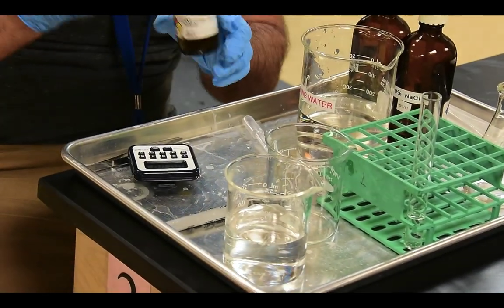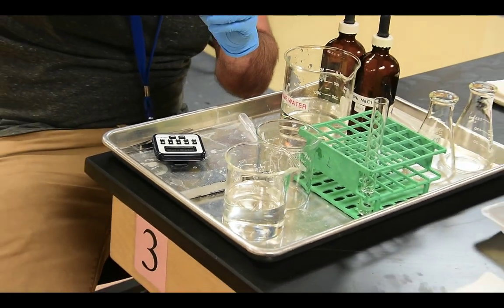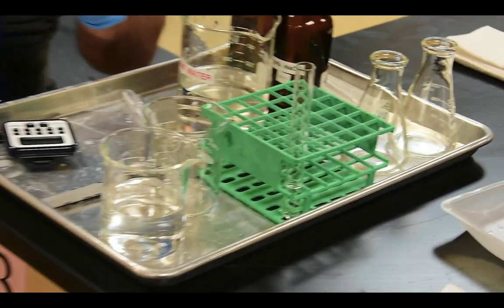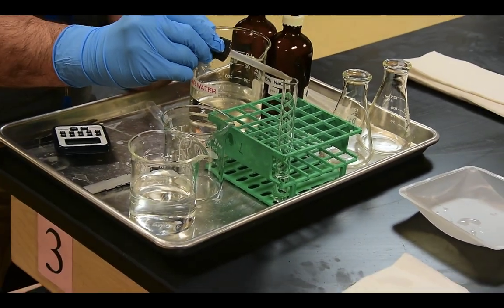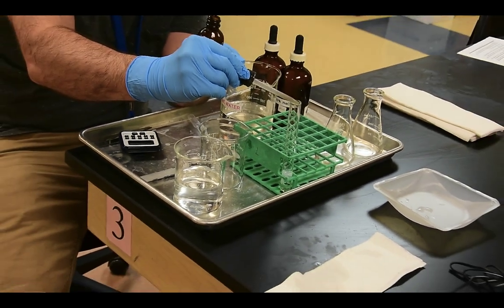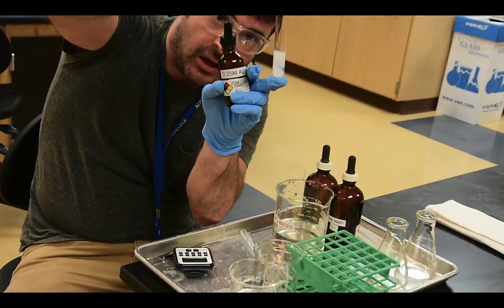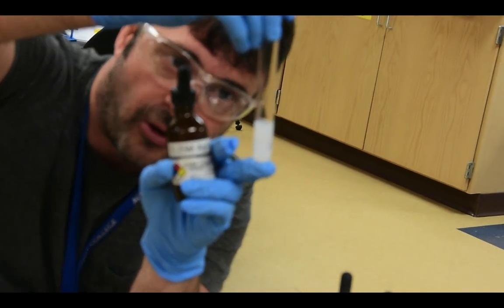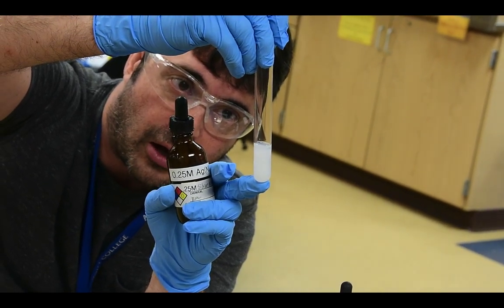And then I'm going to take this silver nitrate, and the volume doesn't matter because silver nitrate, if there is no chloride ion present, is just going to go into solution and you're not going to see it. But if chloride is present, it's going to react with that chloride. So I'm going to add it. Now if you look at this test tube, you'll see that that silver is reacting with the chloride ion to produce a solid precipitate that falls out of the solution, and that's why you see the solution becoming cloudy. That means that chloride ions were present.